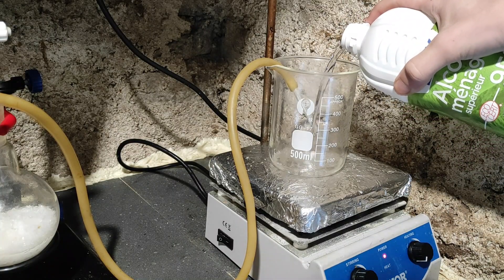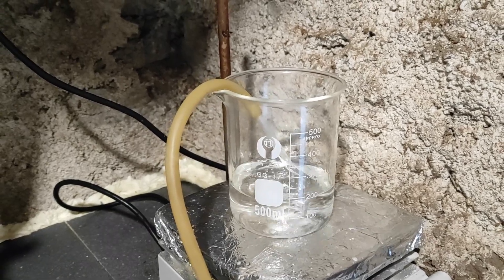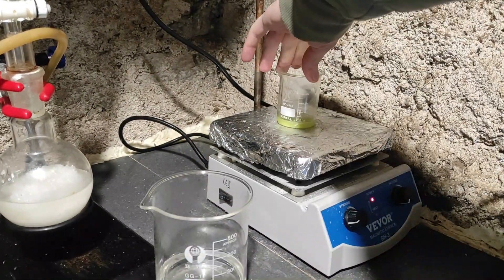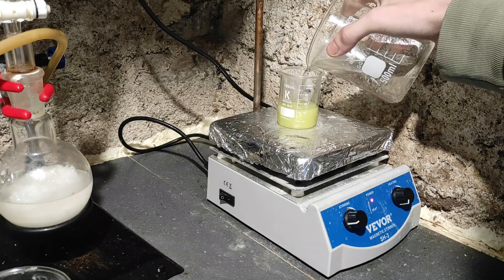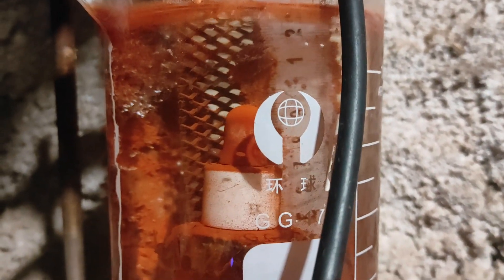Then I dissolved some cerium trichloride in ethanol and added the tin tetrachloride solution, which had somehow turned green. With this solution I repeated the preliminary coating with the blowtorch, and now tried again to coat lead dioxide onto it. I passed half an amp through it for a few hours in the plating bath, and as you can see, we have a beautiful coating.